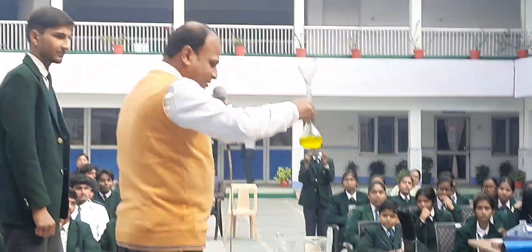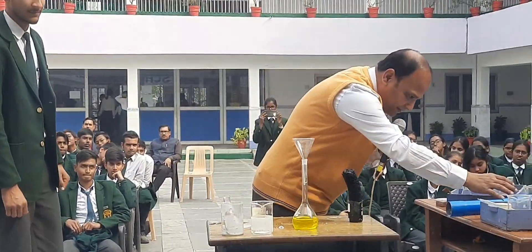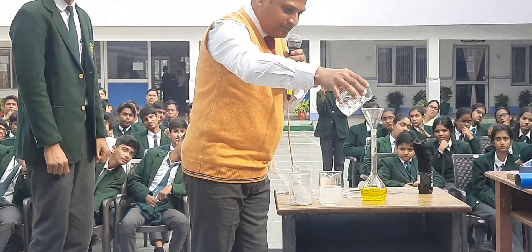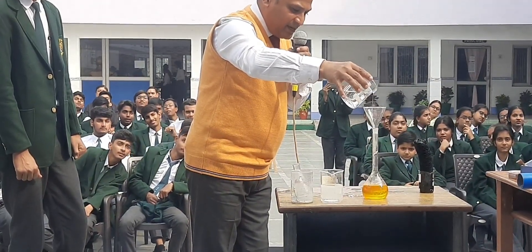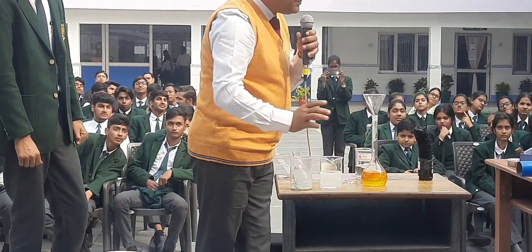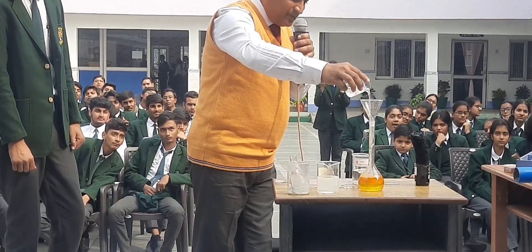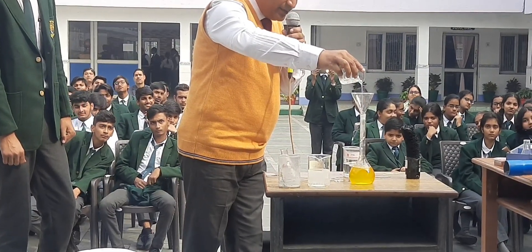Now it is not yet over. I am again adding an acid to this — see what is happening. It has regained its orange color. I am adding NaOH again and it is again changing to yellow color.